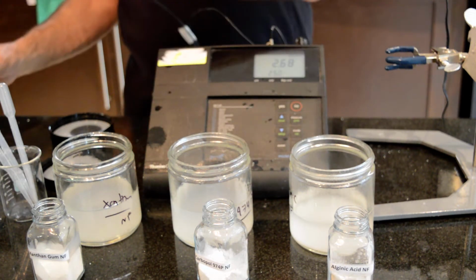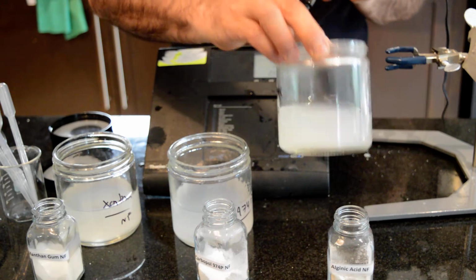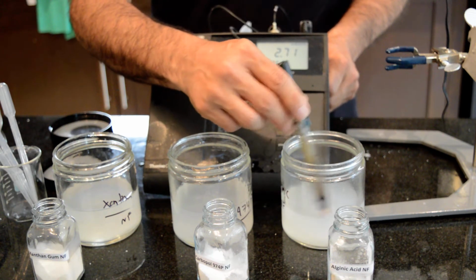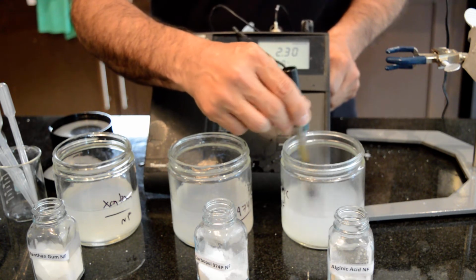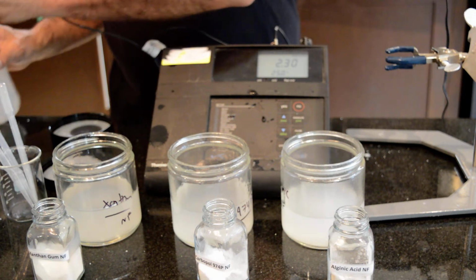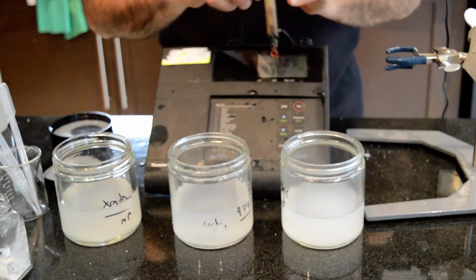The next one, or the third one, is alginic acid, again 1%. And this alginic acid did not even dissolve, so it is very liquidy, and it is separating at the bottom of the flask. If I look at the pH of this suspension, again you see the values are 2.7 and so on. So this is not what you want to use on your skin. So except for the xanthan gum, what we have to do is increase the pH of these solutions to make them suitable for skin products. I'm going to put this aside so that we can have a better picture.